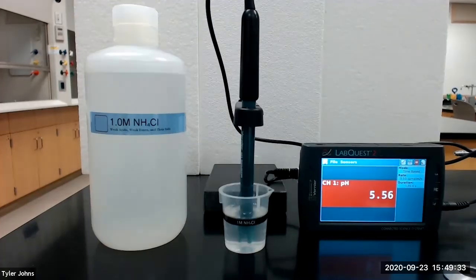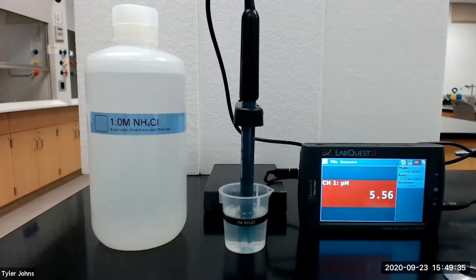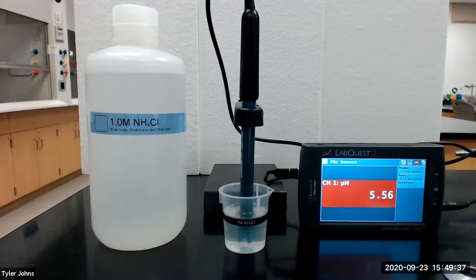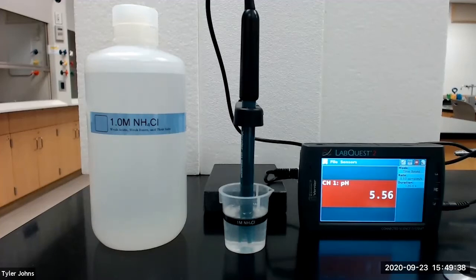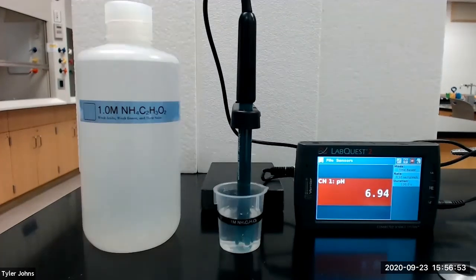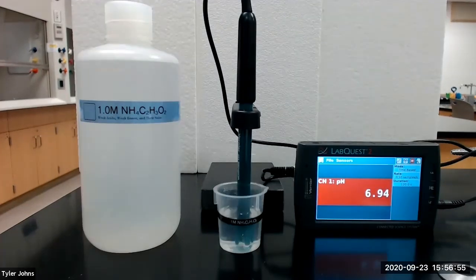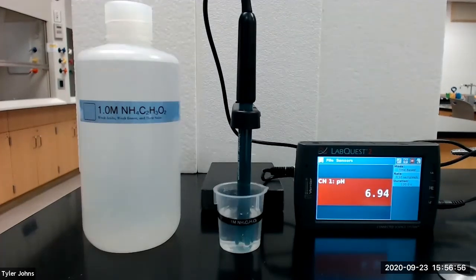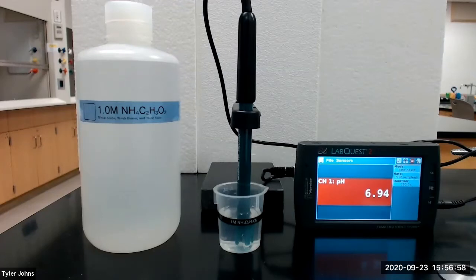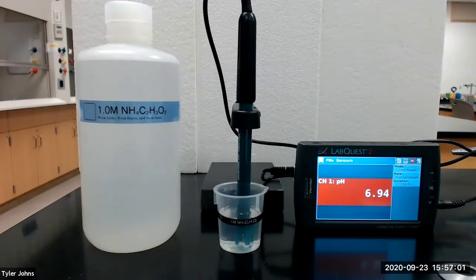Our next salt solution is 1.0 molar ammonium chloride and our ammonium chloride solution has a pH of 5.56. Our last salt solution is 1.0 molar ammonium acetate, and our ammonium acetate solution has a pH of 6.94.